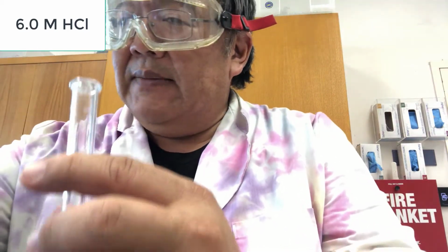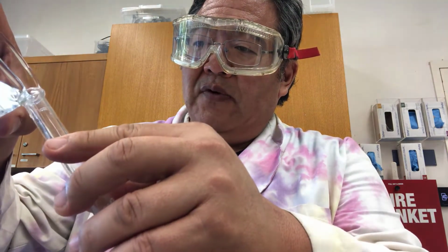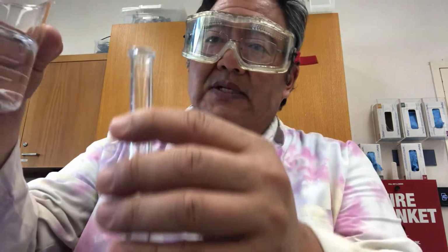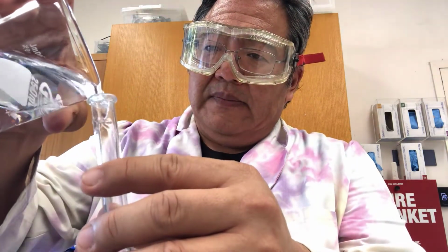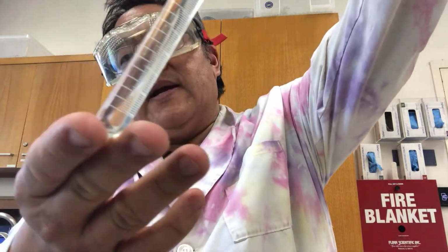Okay, and then I'm going to add this water slowly because I don't want a lot of mixing to take place. Once I've added about 4 or 5 mL of water, that will insulate the rest of the hydrochloric acid from turbulence created by the water coming in, and I can add the rest a little faster. So what's at the top of this tube is essentially pure water, but what's at the bottom of this tube is hydrochloric acid. So now I'm going to take my copper wire and insert it like this.